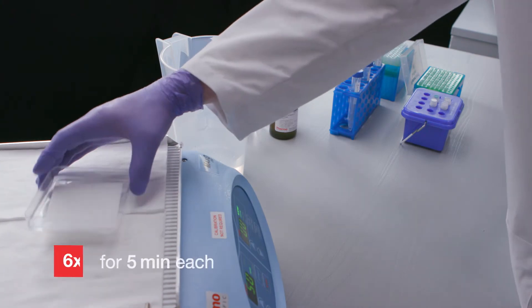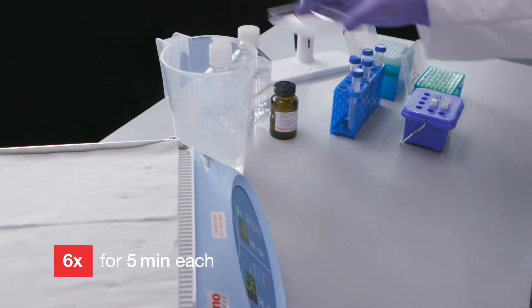Wash the membrane six times for five minutes each in wash buffer with agitation.